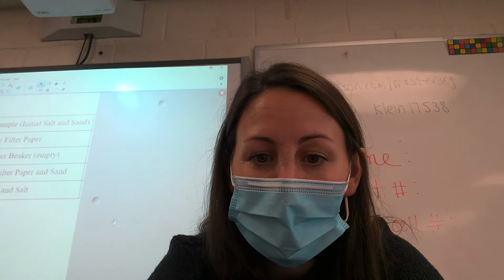Hi guys, so if you're a remote student or if you were absent and missed this lab, you can use this video to make it up. So what we're doing in school today is we're taking a mixture of sand and salt and we're separating it.